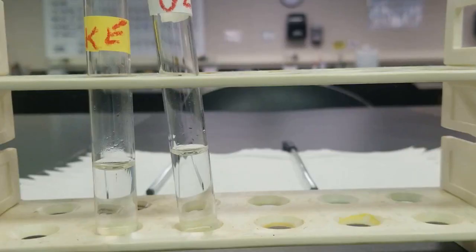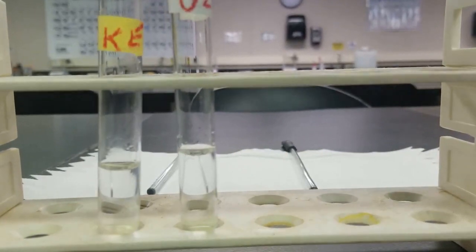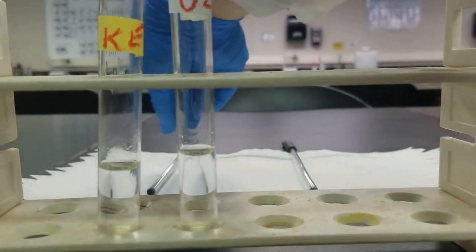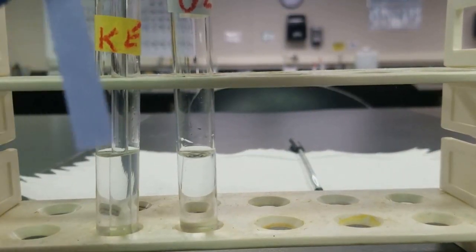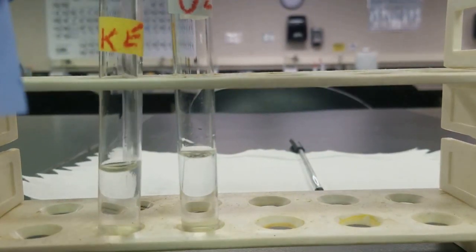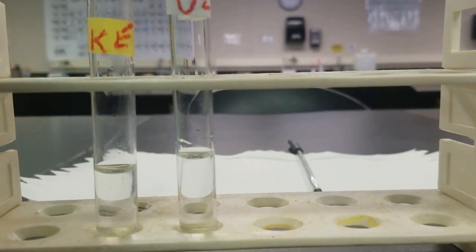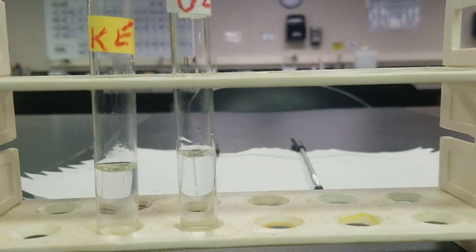All right, so we're done with the sulfate and phosphate step. So we're taking a look at our supernatant back from A2. And if you remember, we basified this. So it's currently basic, and you can test with this litmus paper. If it's acidic, it'll turn this paper red. If not acidic, then it won't. So you see litmus paper here. Take a little bit of my known. You can see it's not changing the color. So we need to add some acid to acidify first.